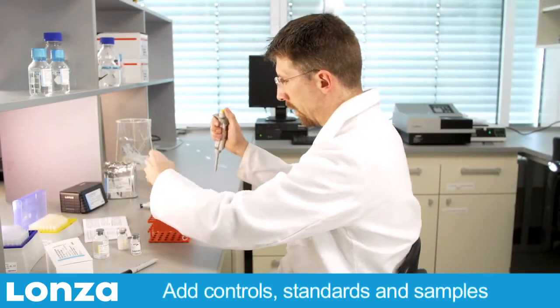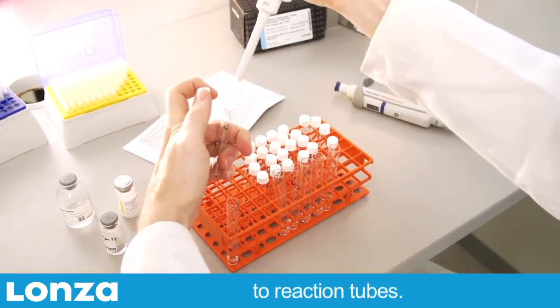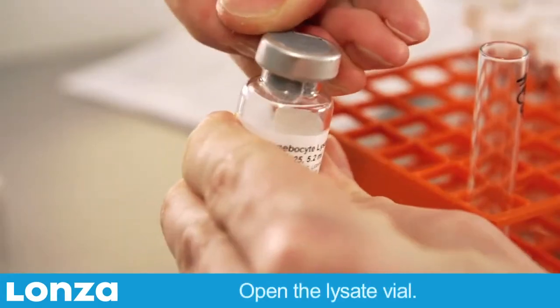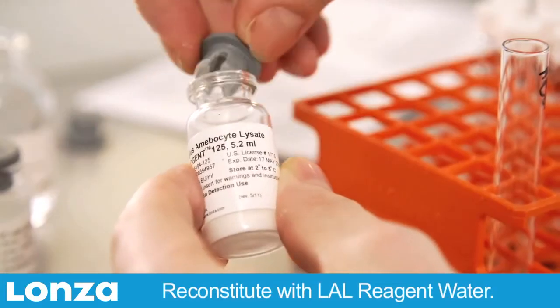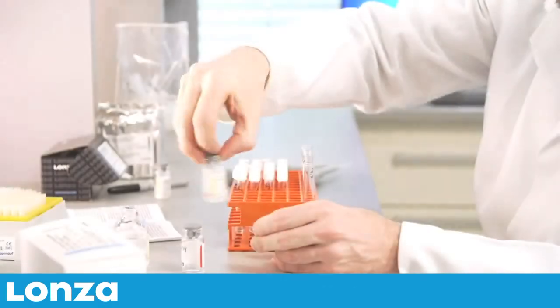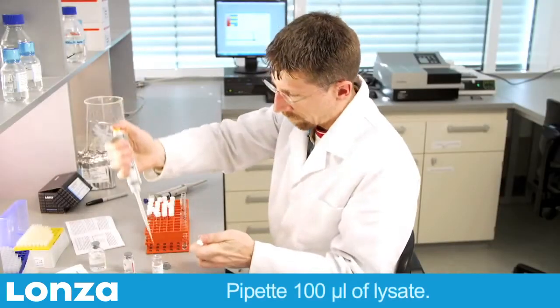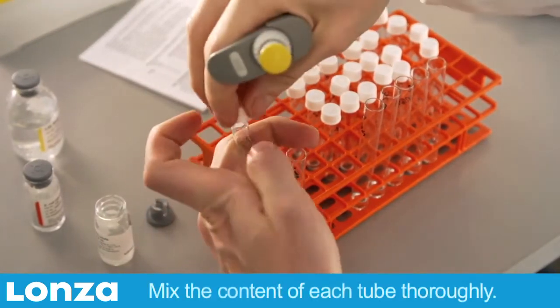Add 100 µL of controls, standards, and samples into each appropriately labeled reaction tube. Carefully remove the crimp and stopper from the lysate vial and reconstitute with LAL reagent water. Gently swirl the lysate — do not vortex. Pipet 100 µL of the reconstituted lysate into each reaction tube and mix the contents thoroughly.